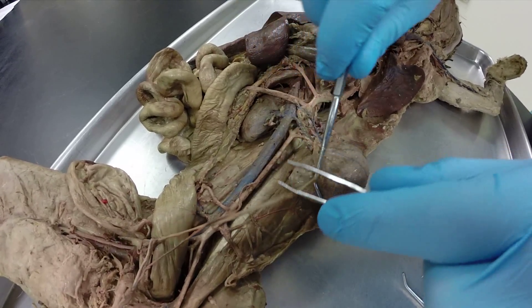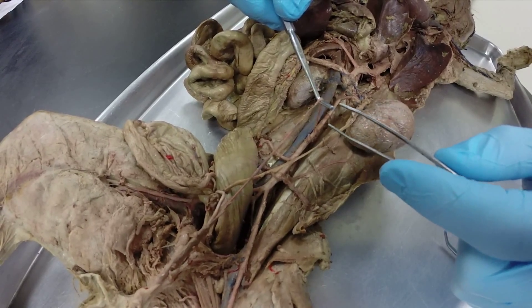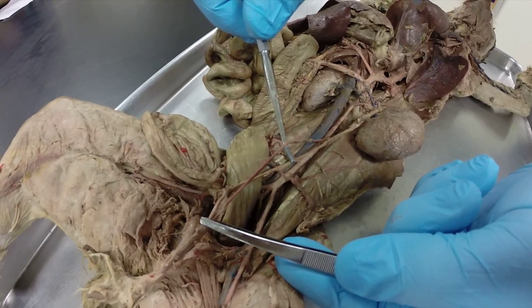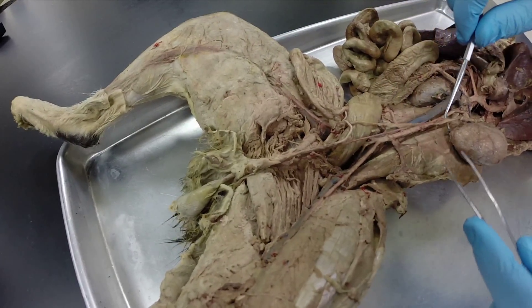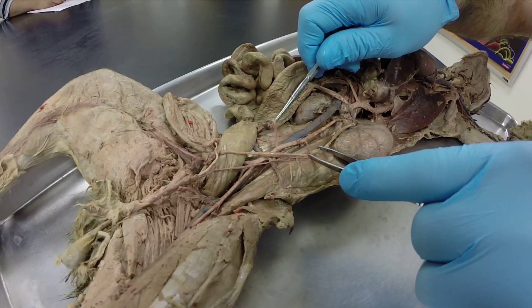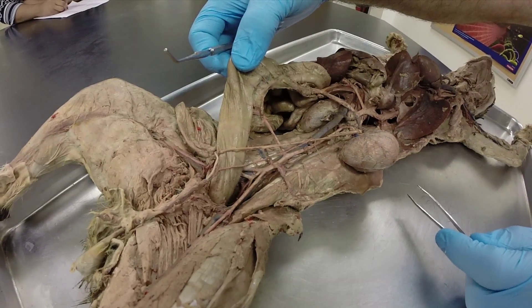Continuing down, the next branch is our gonadal artery, which I have very carefully preserved. This is a male cat, so this is going to travel through the spermatic cord all the way down to the testicle. Then continuing along the descending abdominal aorta, the next branch going to the large intestine is our posterior mesenteric artery.